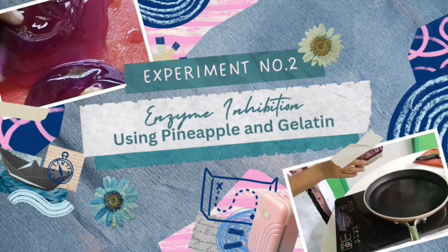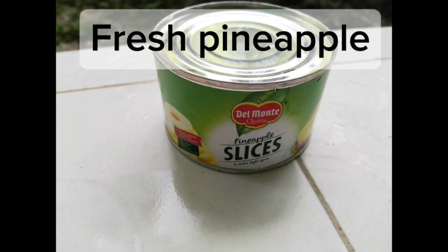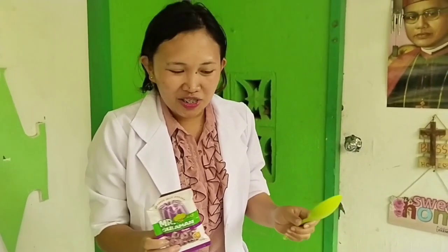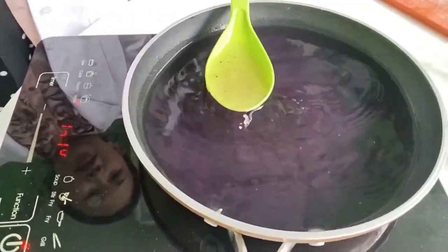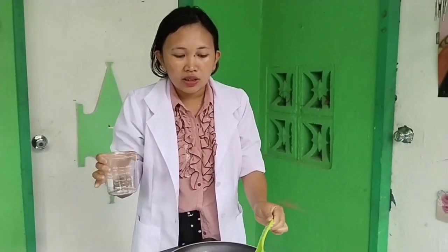Experiment number 2. Enzyme inhibition using pineapple and gelatin. Materials: fresh pineapple, canned pineapple, gelatin. Okay, this time we are going to cook the gelatin according to the instructions inside the package. For the preparation of gelatin, we need to put these mixtures in a beaker.